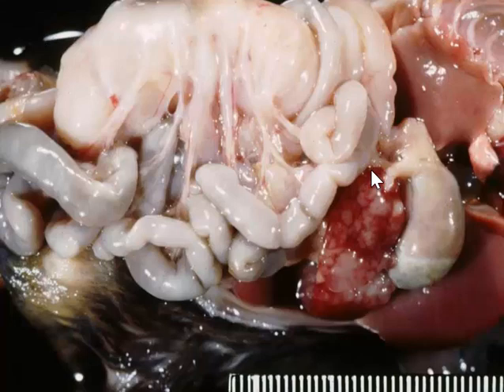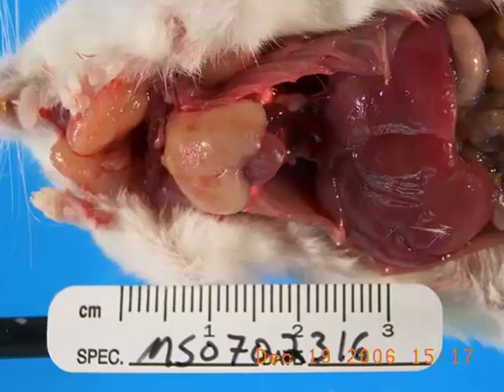In this mouse, the mesenteric lymph node is markedly enlarged, but we can also see changes in the spleen, which has this lumpy, bumpy appearance and is likely filled with lymphoma, and there is a color change here in the liver, which is likely a result of large numbers of infiltrating neoplastic lymphocytes. Another mouse with very large lymph nodes, an enlarged liver, and a very large thymus.